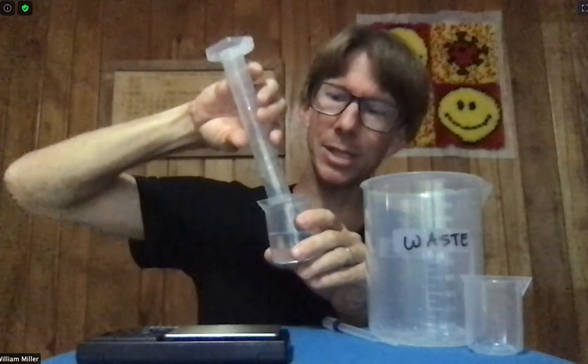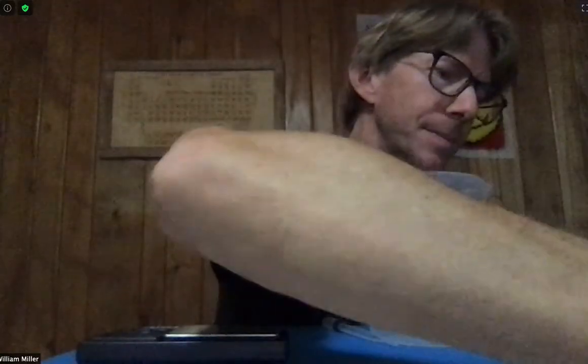Small things like this are important in this lab, so please be careful to condition and think about conditioning as you go through the experiment. Now I've got my solution of known concentration in my beaker, and I need to determine its density.